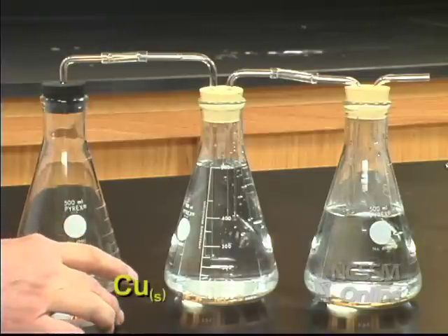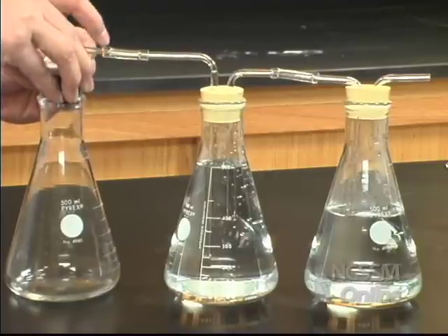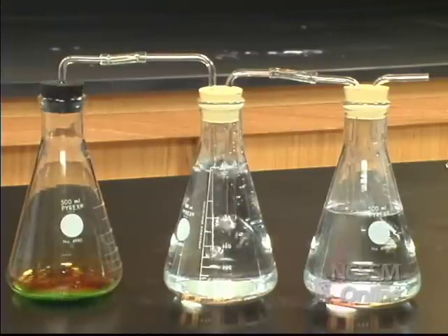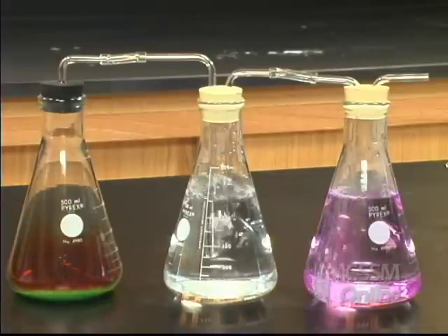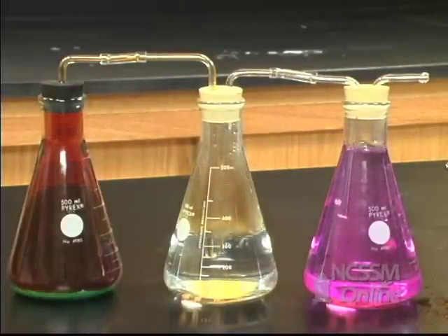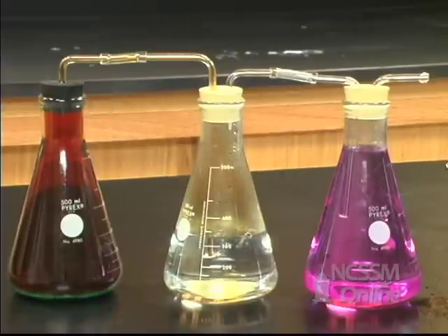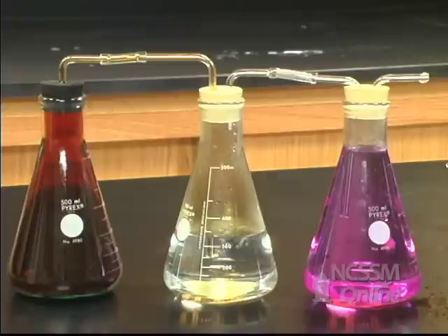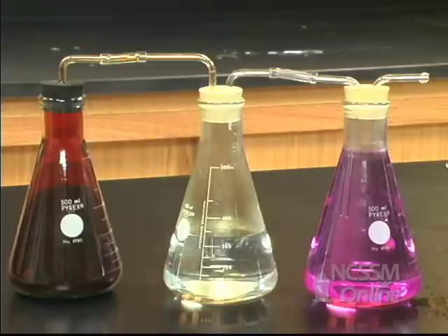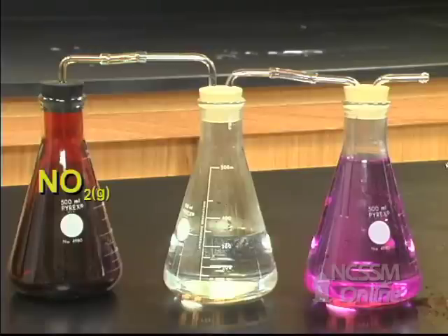I'm going to add copper metal wire to the first flask. In the first flask, we've generated a lot of brown NO2 gas. When the copper is used up, the reaction will stop.